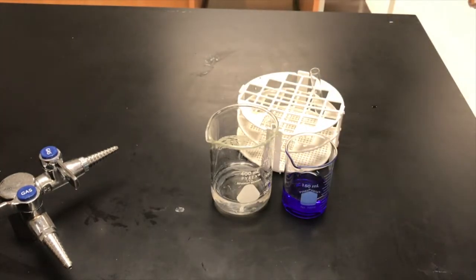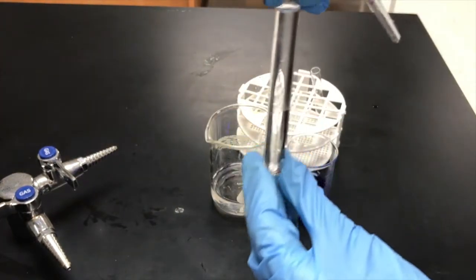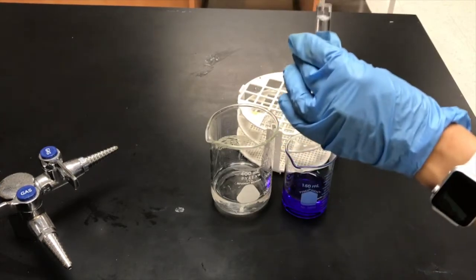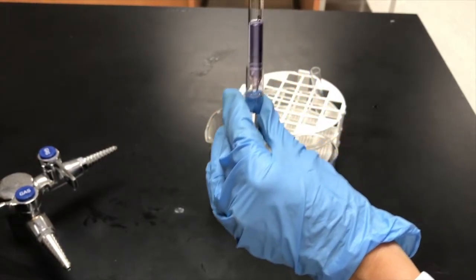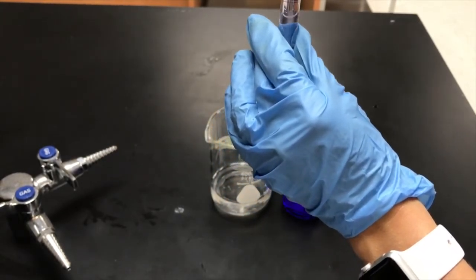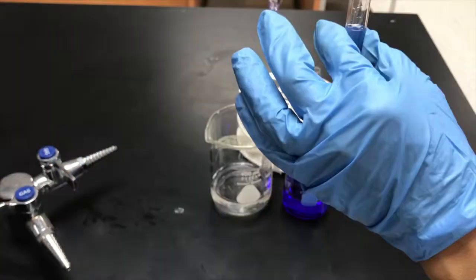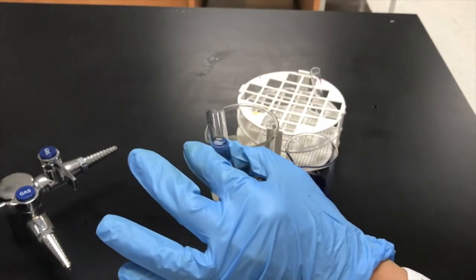Now I'm going to add one mil of the crystal violet solution. Notice I'm super close to the top of the cuvette. I'll grab one mil of crystal violet and add a little bit to the water, but it's going to start to overflow. So I'll suck up more water into my volumetric pipette and expel some — I'm mixing. Now I've got crystal violet and water mixed, and I'll get rid of some of the solution to bring the volume to the correct level.